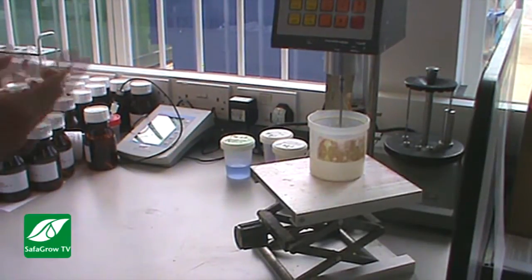So it's friction against the viscosity? It's drag. Right, okay, so it's almost like torque in a way, as an engine would. It's a complicated piece of maths, but this is at 0, and that's at the speed you set, and you can determine the viscosity because of that. Okay, that's good.